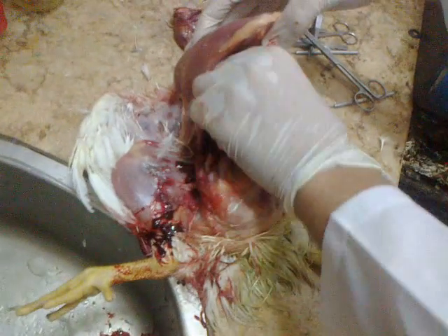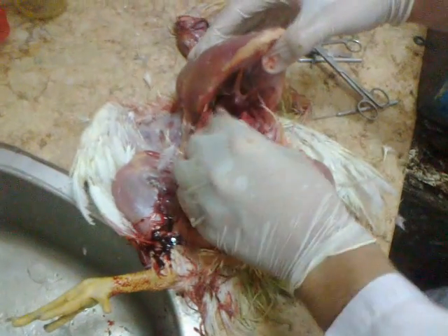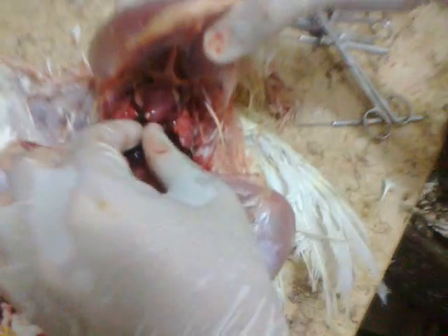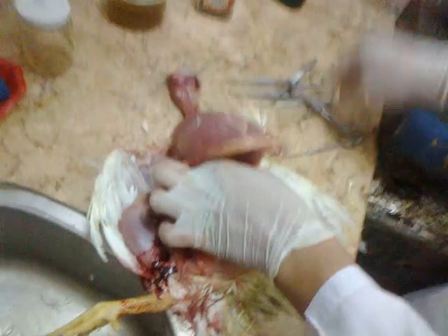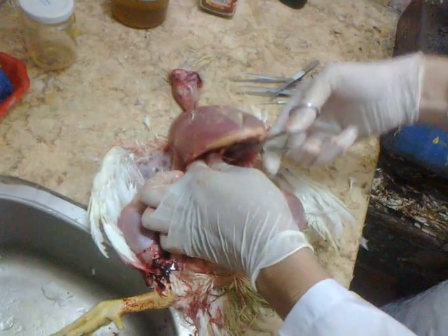You can see the heart here. You check the heart for the pericardium — pericarditis, hydropericardium, or any other lesions in the heart. You check with the post-mortem findings of the corresponding disease.